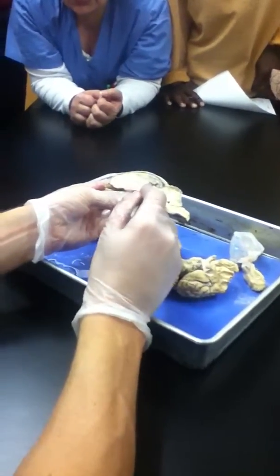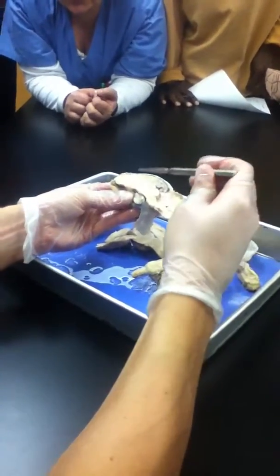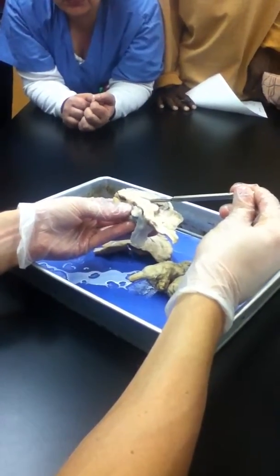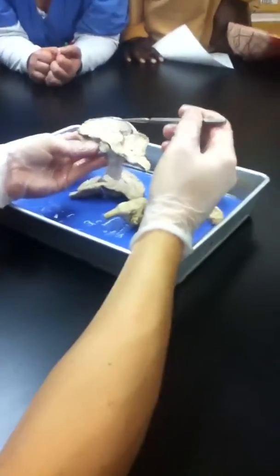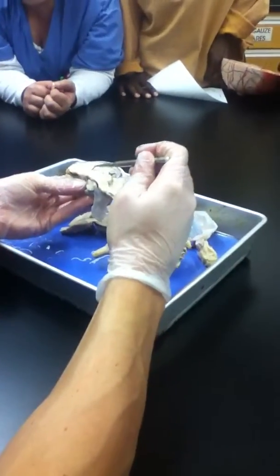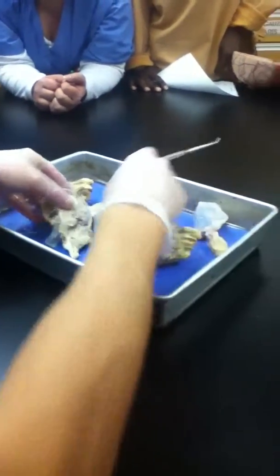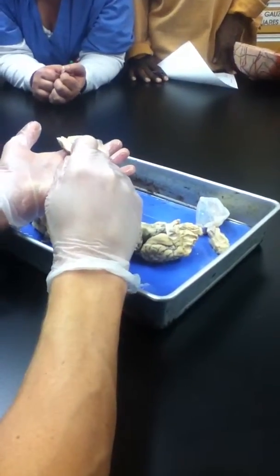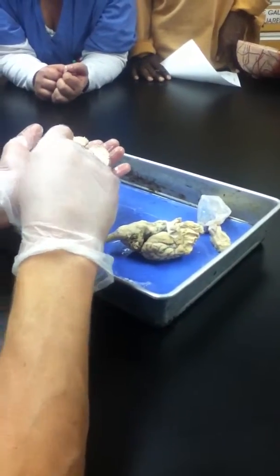Corpus callosum, right? The white matter that connects right to left hemispheres, that curving white matter right there. And watch this. Notice how much of the probe just disappeared. Where did it go? The hidden space. The lateral ventricle, right? We said there are chambers that enclose CSF, one of which never crosses the midline, but there used to be a membrane right there that we puncture through, and sure enough, we're down into the lateral ventricle. And of course, we can similarly see it on this half, so yes, they are paired. So sure enough, right where you find that corpus callosum, it leads into a space there, the lateral ventricle.